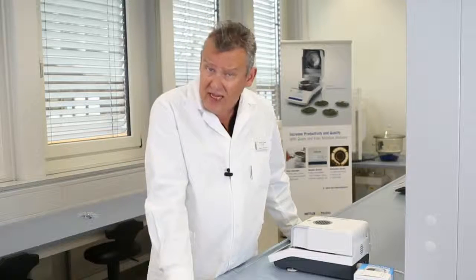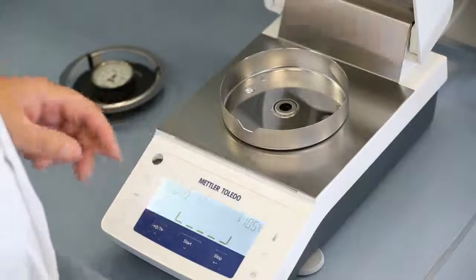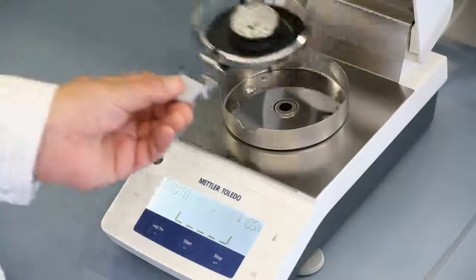To adjust the heating unit, remove the pan handler, place the temperature calibration kit.